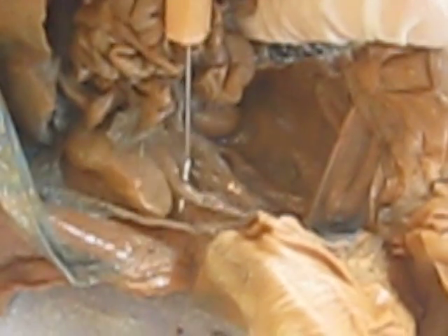Now still moving inferiorly, this right here is the kidney, and there's another kidney on this side. So the ureters are coming out of the kidneys. There's one ureter, and there's another ureter, and they carry the urine down. And this right here are the umbilical arteries, and this is the urinary bladder.